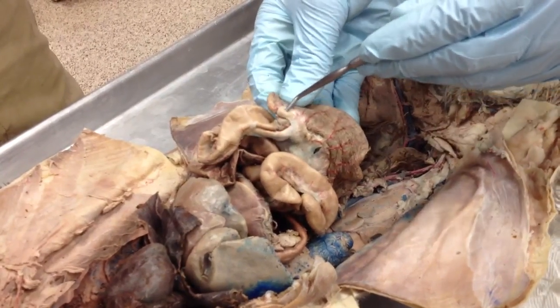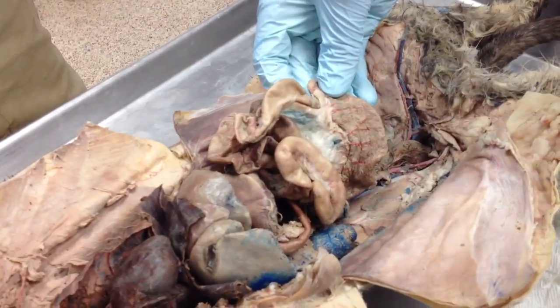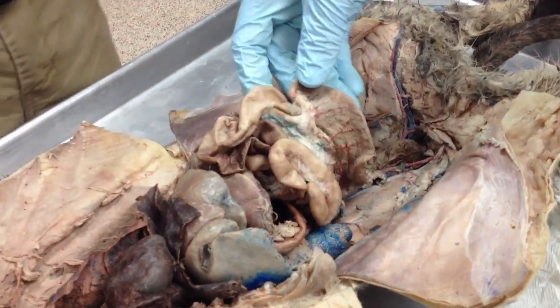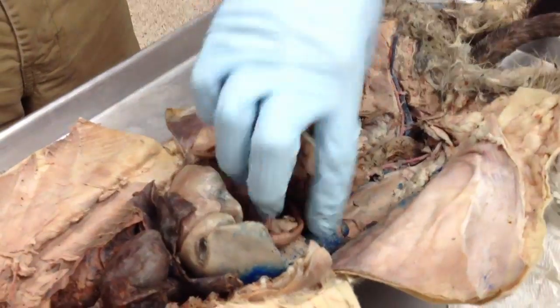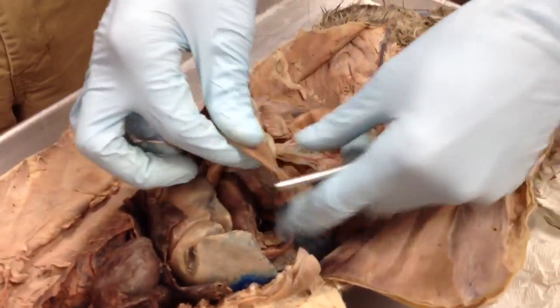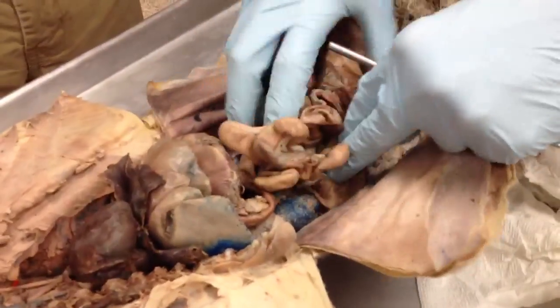So you see that fleshy kind of structure right there. If you answer that on the test, I'll give you credit for it, but don't walk out of this class telling everybody that's where your appendix is. I'm not sure about that. So it's oriented in your body like this.